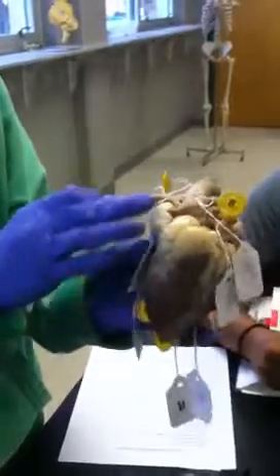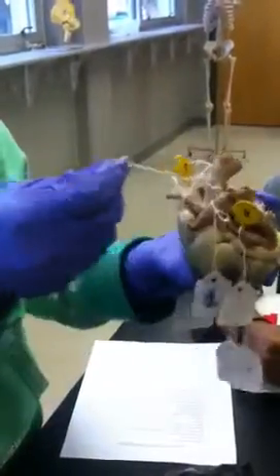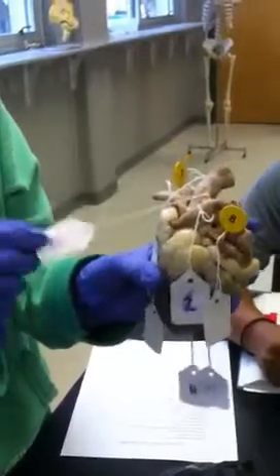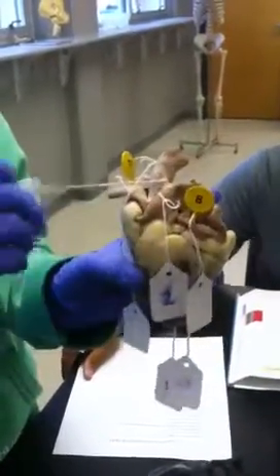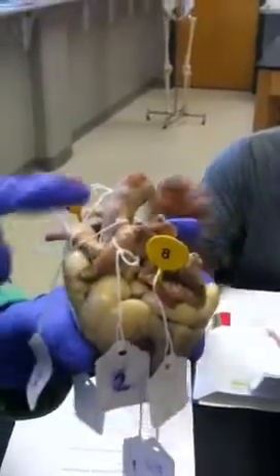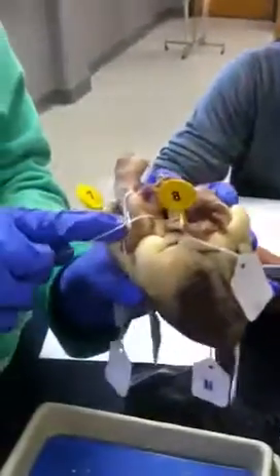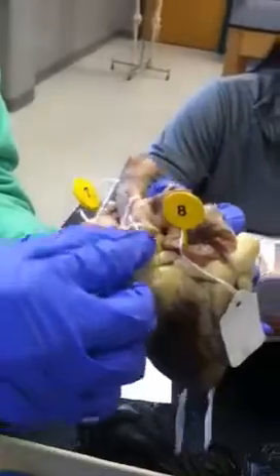Okay, this is the anterior side of the heart, and this is the posterior side. Notice the aorta curves to the back for the anterior side. Number 1 is the ligamentum arteriosum, which connects the aorta and the pulmonary trunk. Number 2 is the pulmonary trunk, which routes the blood to where gas exchange occurs.